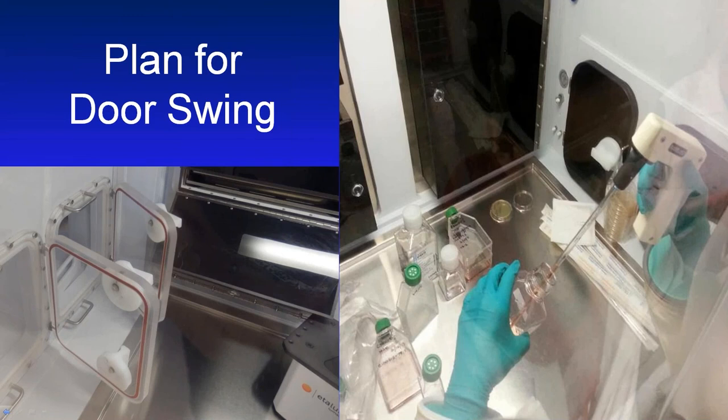Plan for door swing. Now, in a biological safety cabinet, you don't have to worry about doors, but in the Xvivo system, you're going to have doors that are going to have to be opened at some point during your process, whether that is into a neighboring buffer chamber or into an incubation chamber. So you're going to need to plan for door swing when you lay out your workspace.